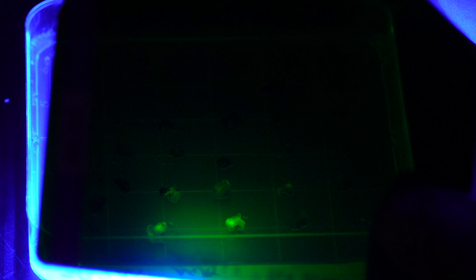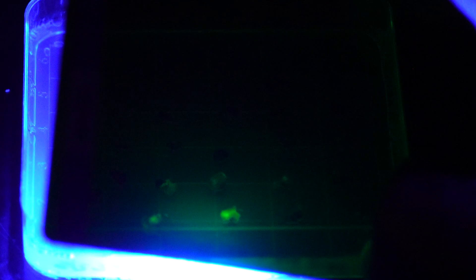Wow. Do you see those little fluorescent babies? They're glowing like gems! I was not expecting it to be this magical. We did a great job last time — glowy green. Oh my god, we did. That's right, we transformed some columbines! I can finally say, in my scientific career, I have transformed some columbines. Finally.